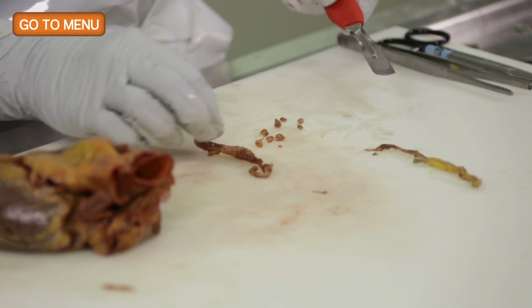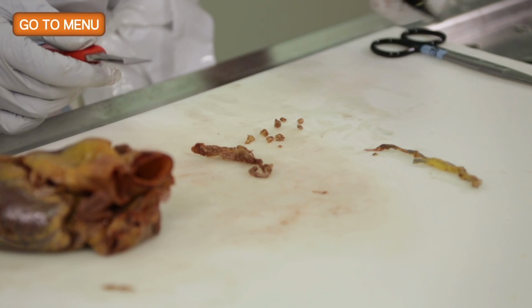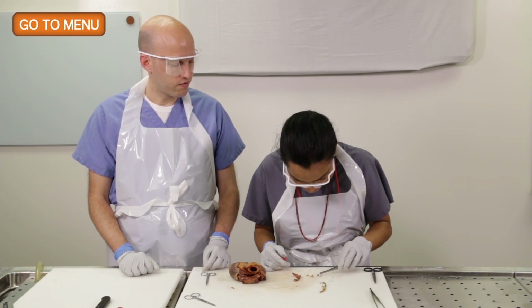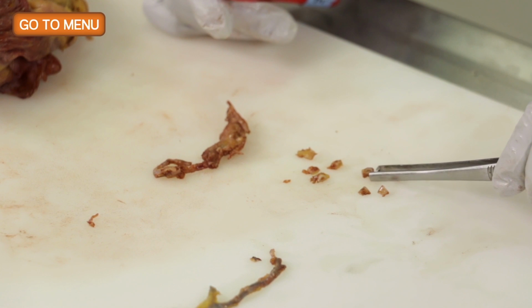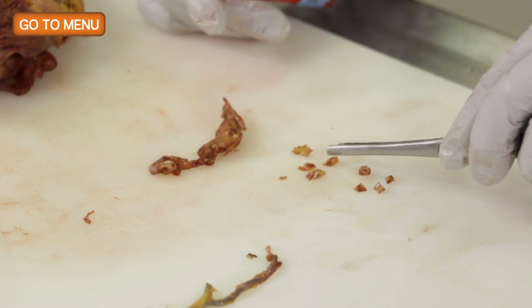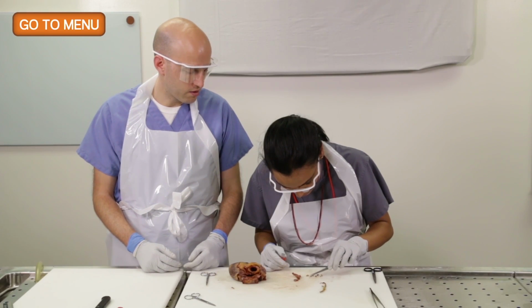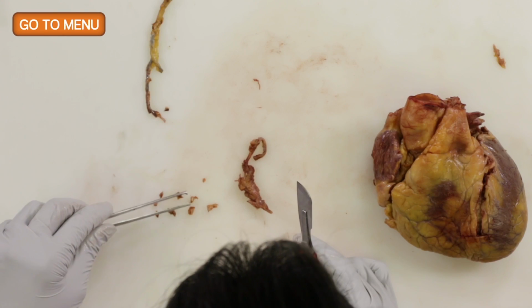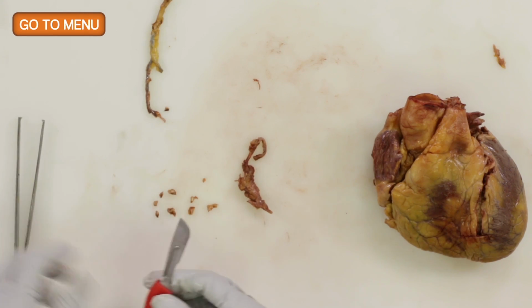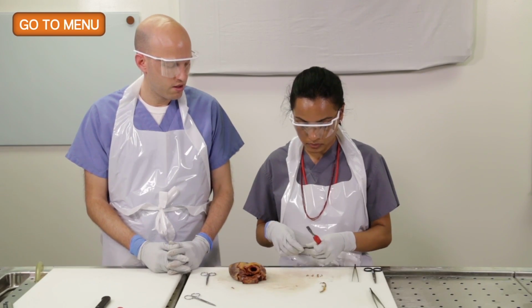All right, so that's the circumflex. So what would you rate the amount of stenosis of the circumflex? I would say mild. Yeah, and so we could do it as mild, moderate, severe, or you can give a percentage. I agree that it looks mildly stenotic at most. No thrombosis, right? No. All right, so same thing with the LAD and left main.